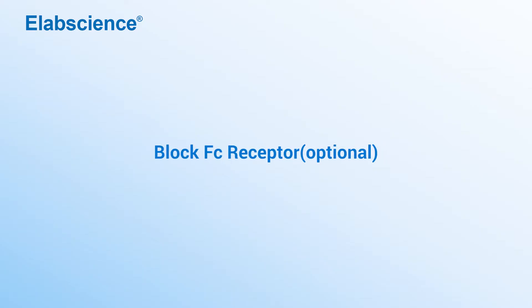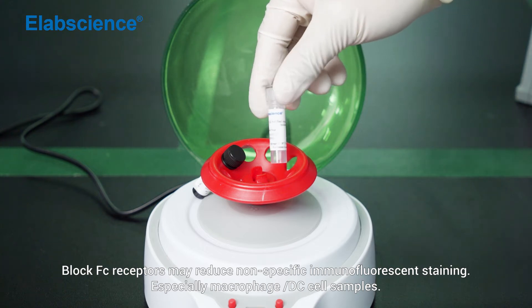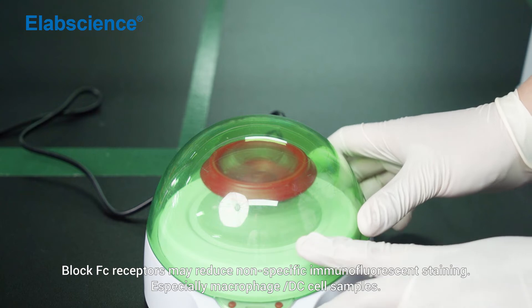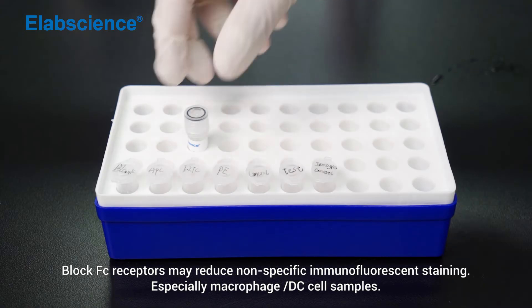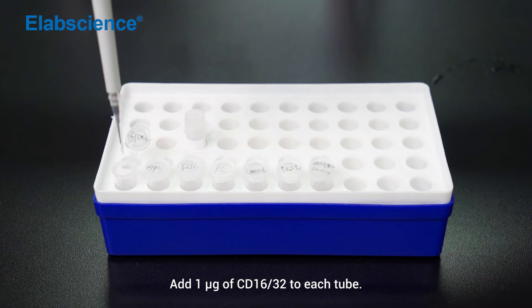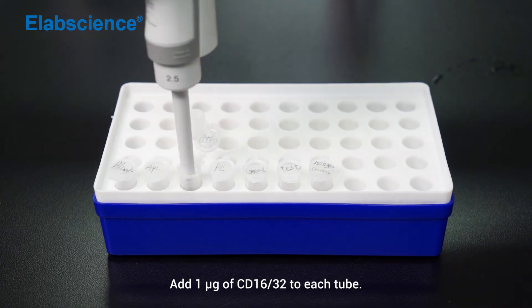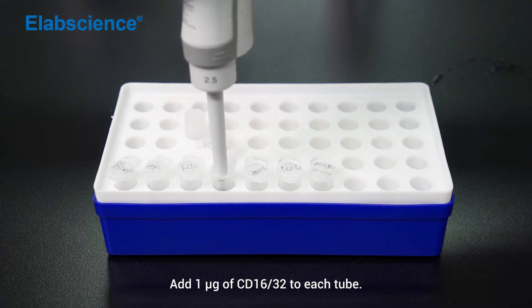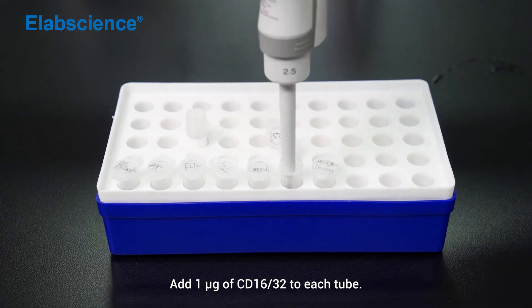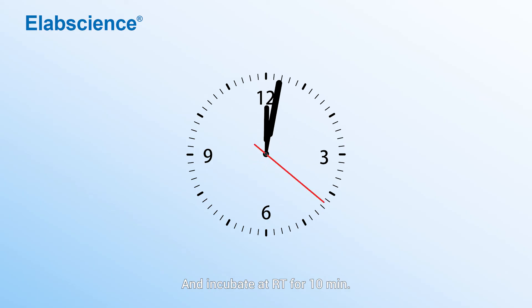Block Fc receptor. Blocking Fc receptors may reduce non-specific immunofluorescent staining, especially for macrophage or dendritic cell samples. Add 1 µg of CD16/32 to each tube and incubate at room temperature for 10 minutes.